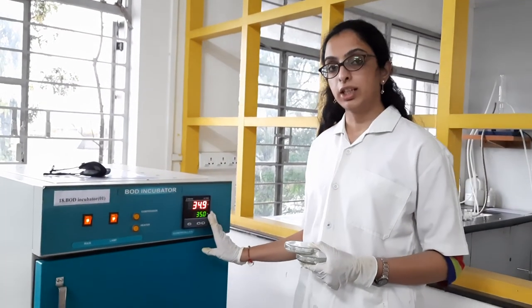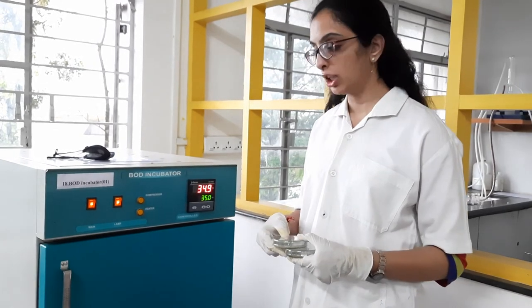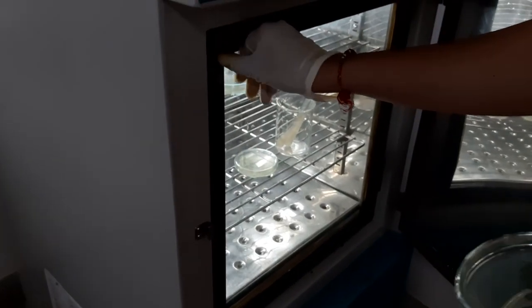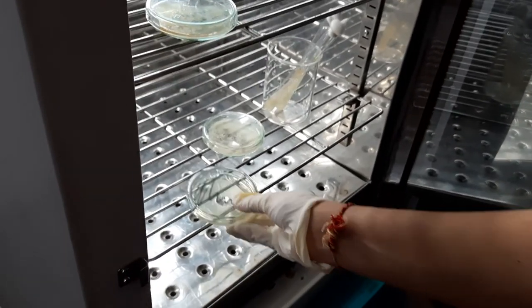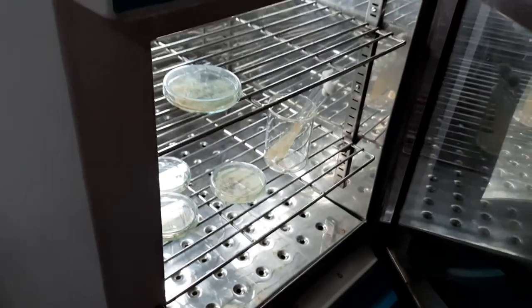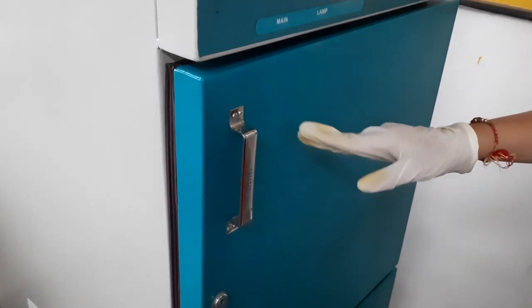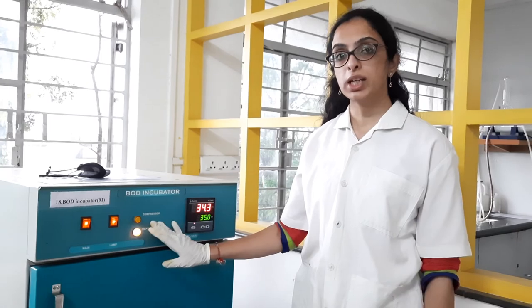I have set the temperature to 35 degrees Celsius, which is the optimal temperature, and now I will place these plates in the incubator. As discussed earlier, just slide the plates so that they will not open, otherwise contamination from the air can enter. Now we have placed the plates for incubation and then we will observe the colonies.